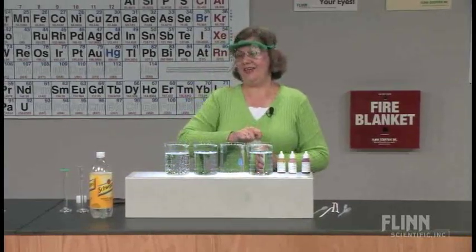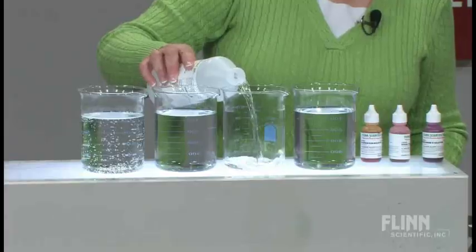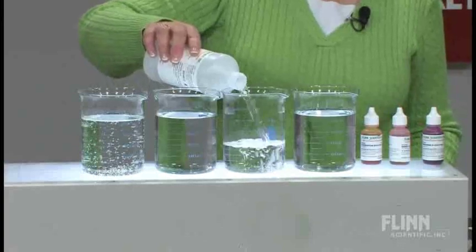In the third beaker, rather than placing distilled water, I'm going to use ethyl alcohol, because the third substance that I want to look at is not soluble in water and is soluble in ethyl alcohol.